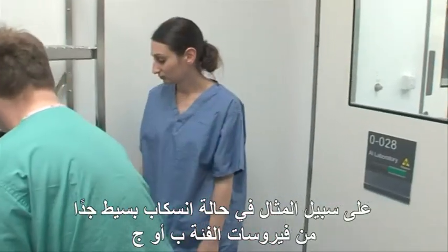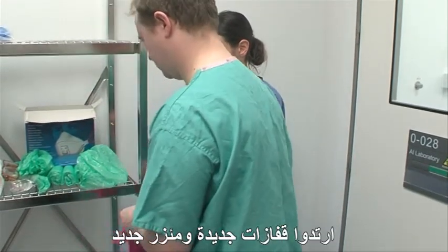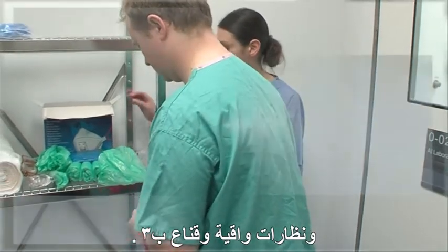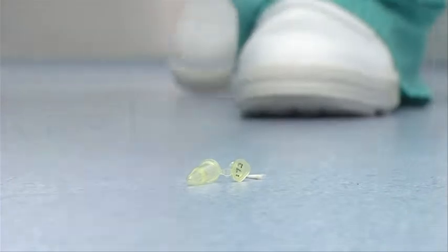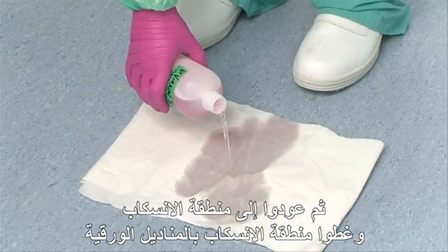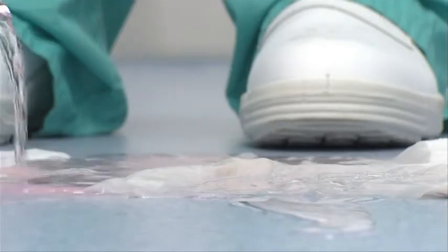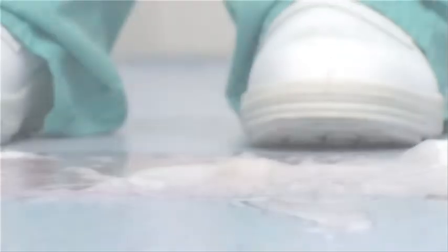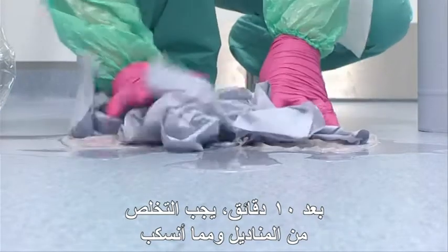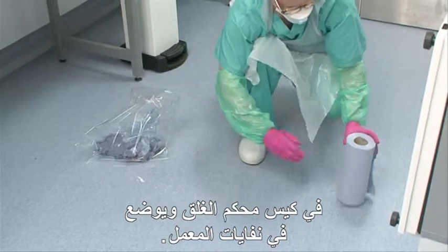In the example of a very small spill of a Category B or C virus, put fresh gloves and an apron on, safety glasses or goggles and a P3 mask. Then return to the spill area, cover the spill with tissue paper and flood with 1% Virkon solution. After 10 minutes, the tissue and the spill should be discarded into a bag, which is then sealed and placed in the lab waste.